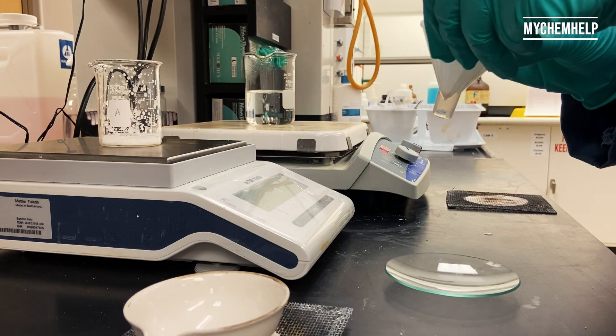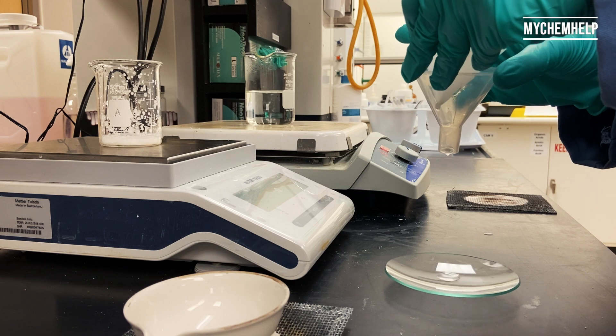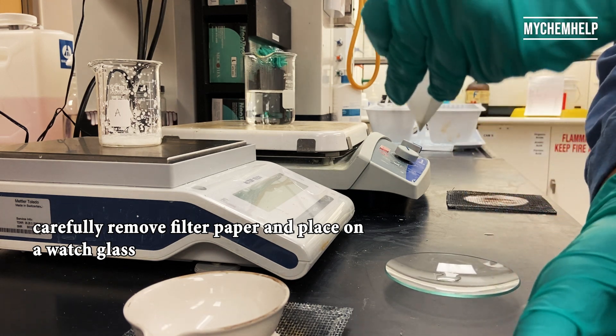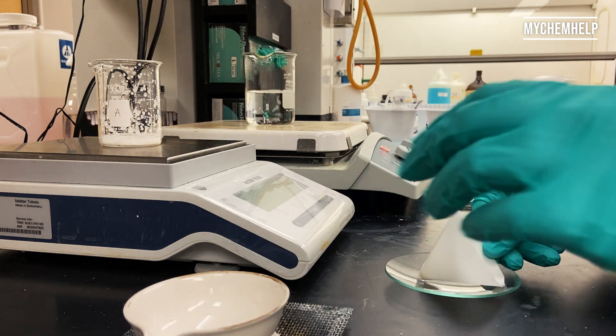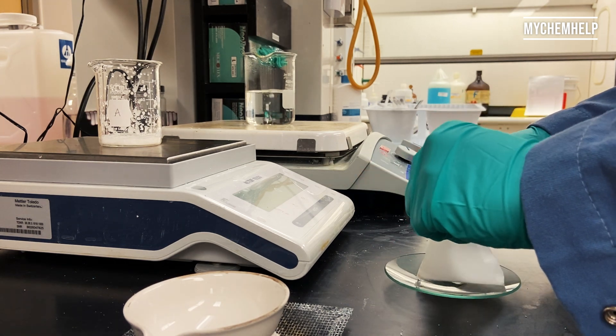All right, and once that's completed, you're going to carefully transfer the filter paper onto a watch glass, and just dry out that filter paper.